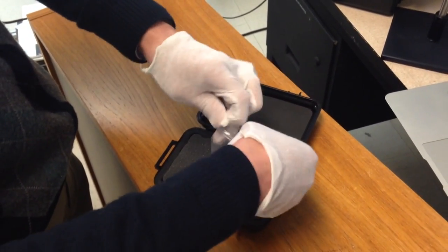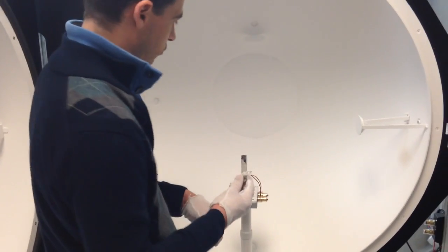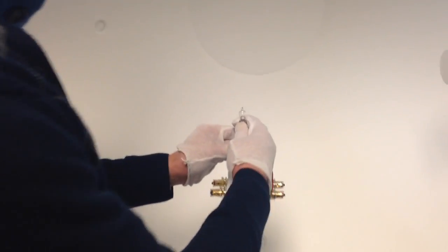Always try to keep track of the hours that are on your calibration lamp. So this particular one is 600 lumen. It has a bayonet socket, and we're going to install it in the lamppost here.